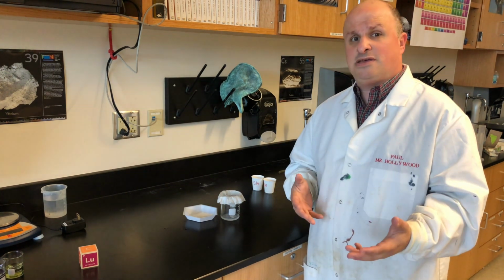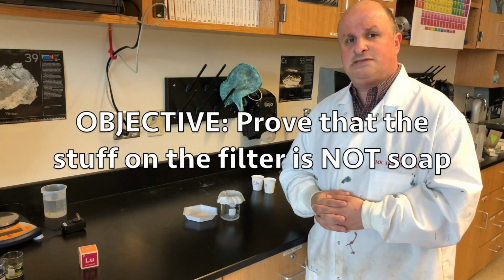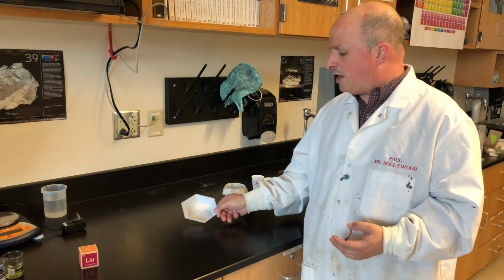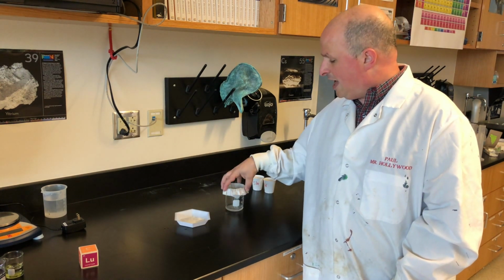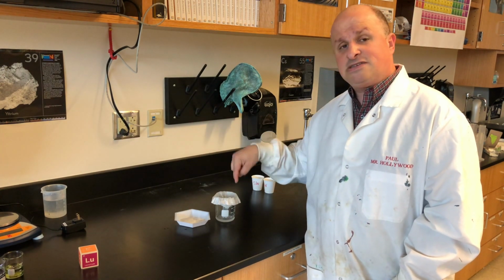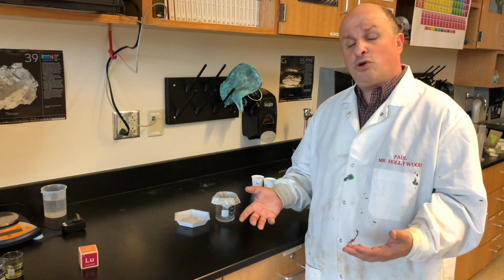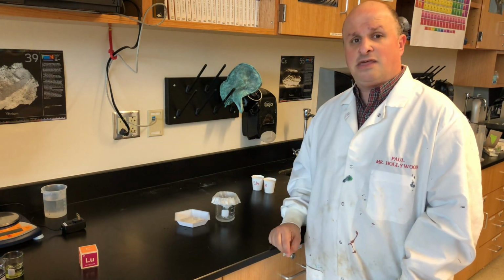And your job is going to be to figure out how you can prove that we made a new substance, that the stuff that's on the coffee filter is not soap. So to help you with that, I'm also going to give you a tray, a weighing pan that has some soap in it, the same exact soap that we used, and it's going to be your job to come up with a way to show that this and the stuff on the filter are not the same thing. Your challenge, you get to decide how to do it. I'll give you some equipment on your lab station, and you decide how to prove that this is not that.